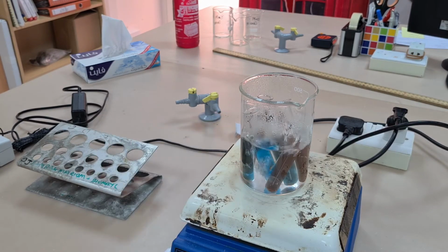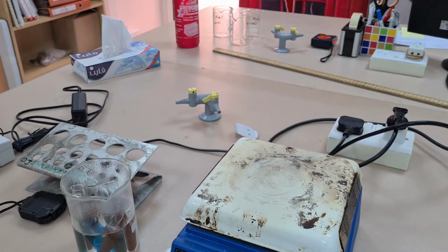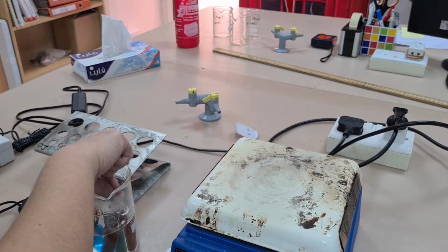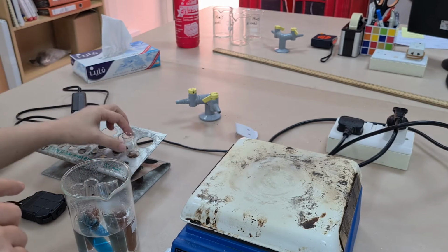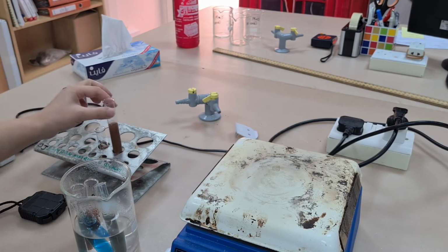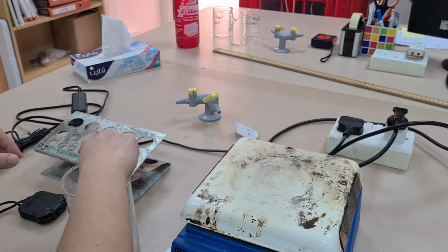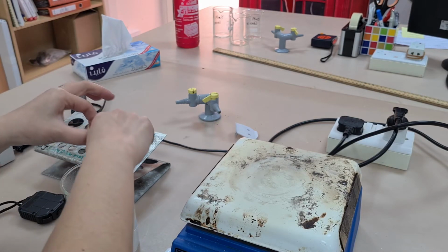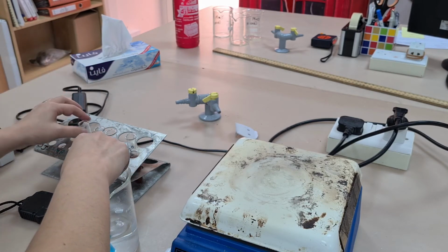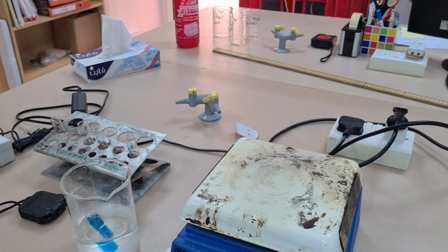Now in just 4 minutes you can see that the brick red precipitate is starting to develop. You can see that those test tubes actually need shaking to mix the reagent properly with the rest of the solution. Benedict's reagent actually contains copper sulfate, hence its blue colour. When it's heated with the reducing sugar, it reduces the copper sulfate and changes it to copper oxide, and that is what's left behind. Copper sulfate is soluble, and that's where the blue clear solution comes from, and copper oxide is insoluble, and that's where we get the precipitate from.